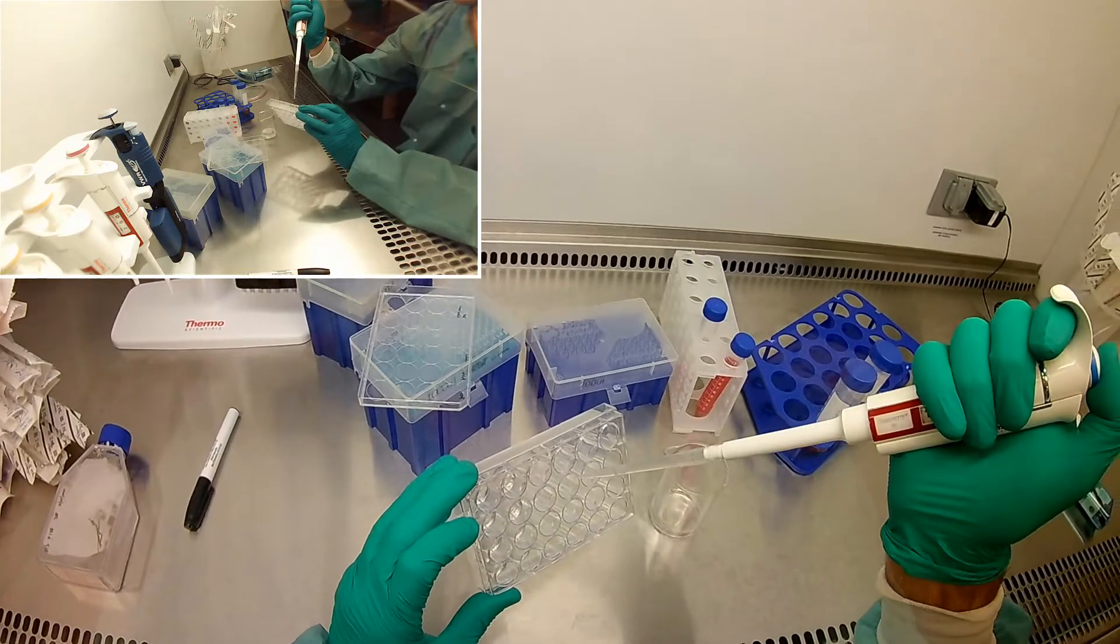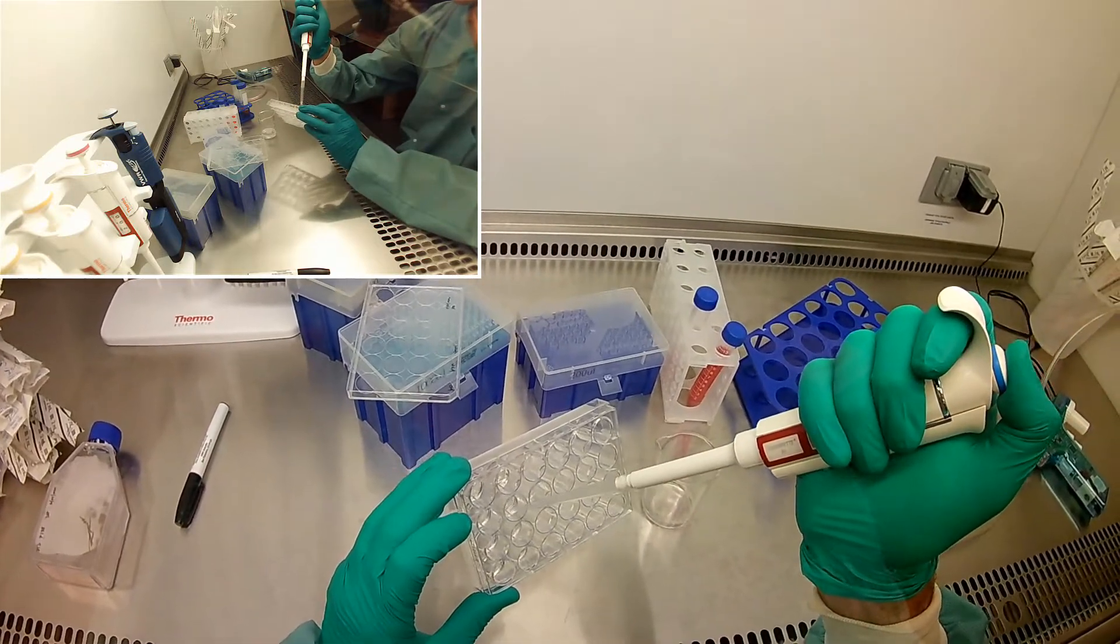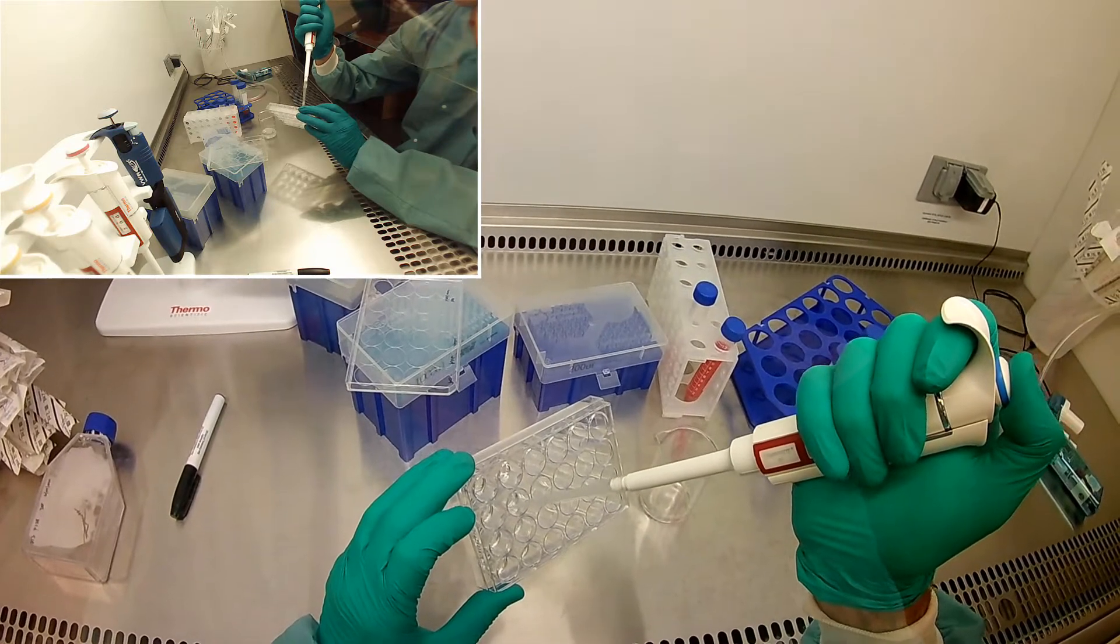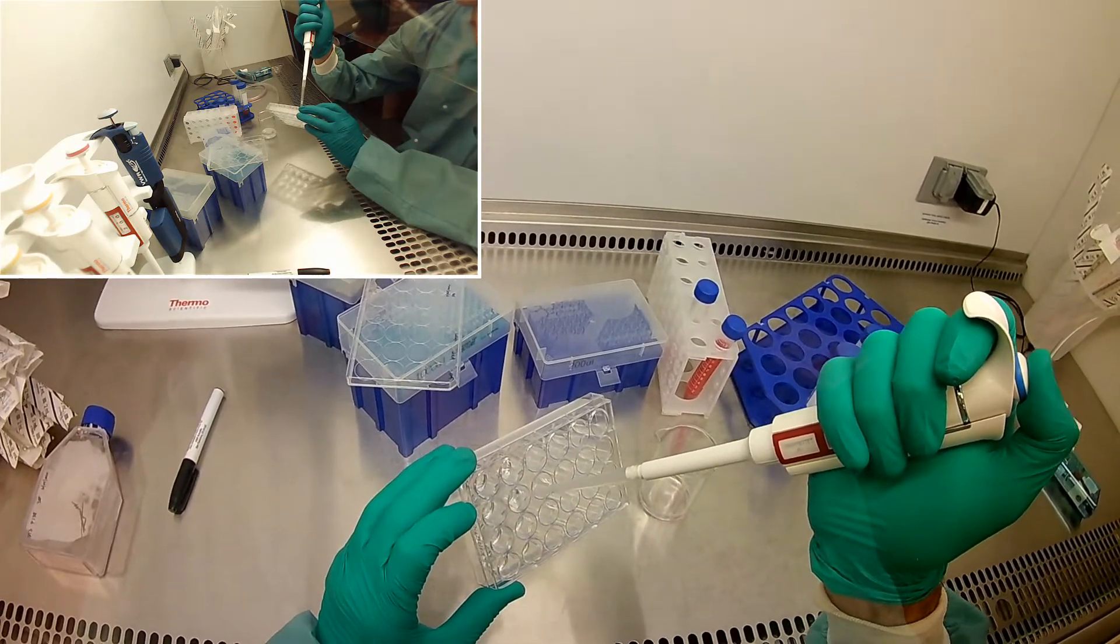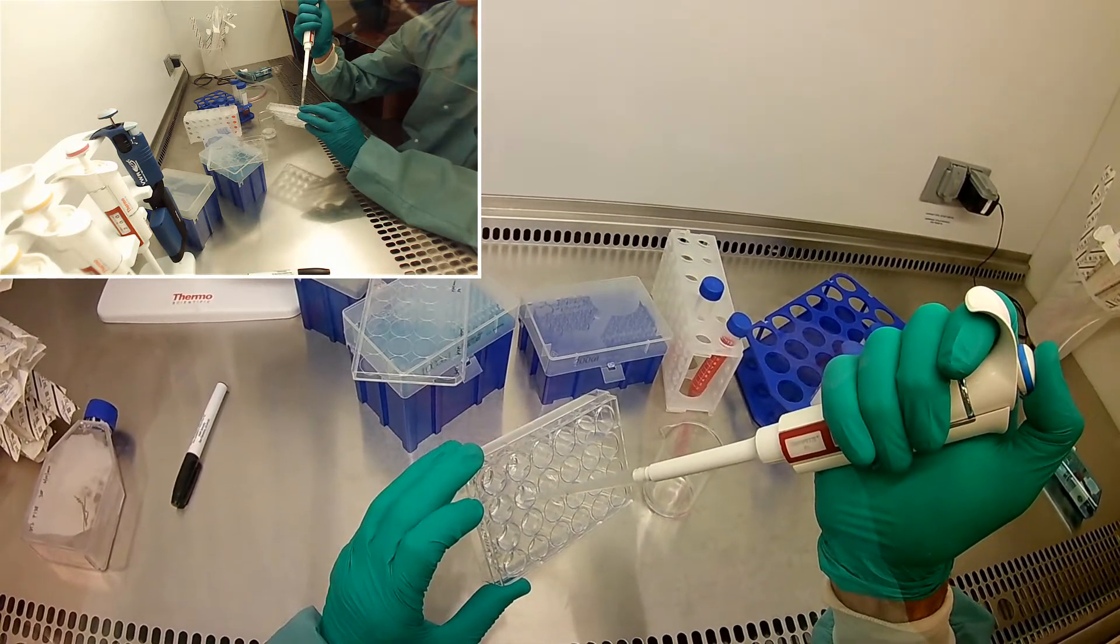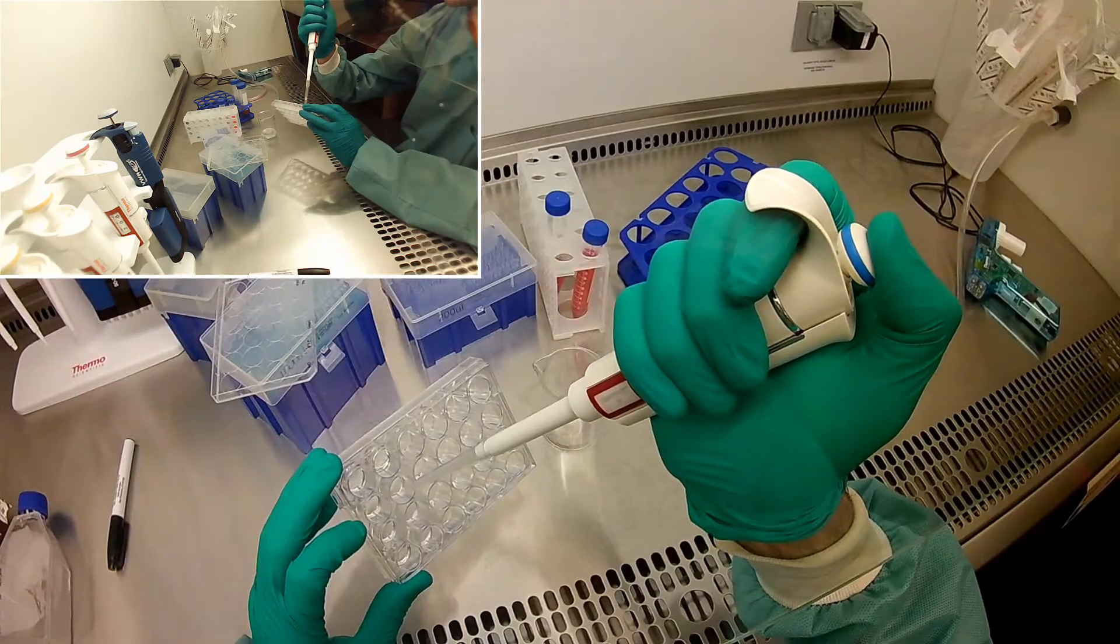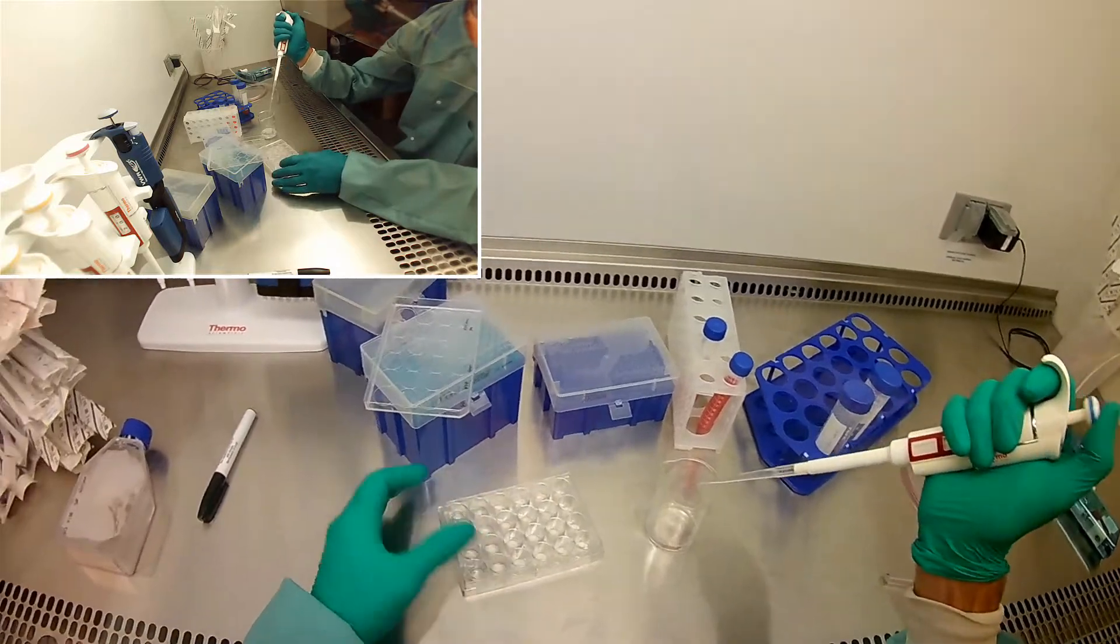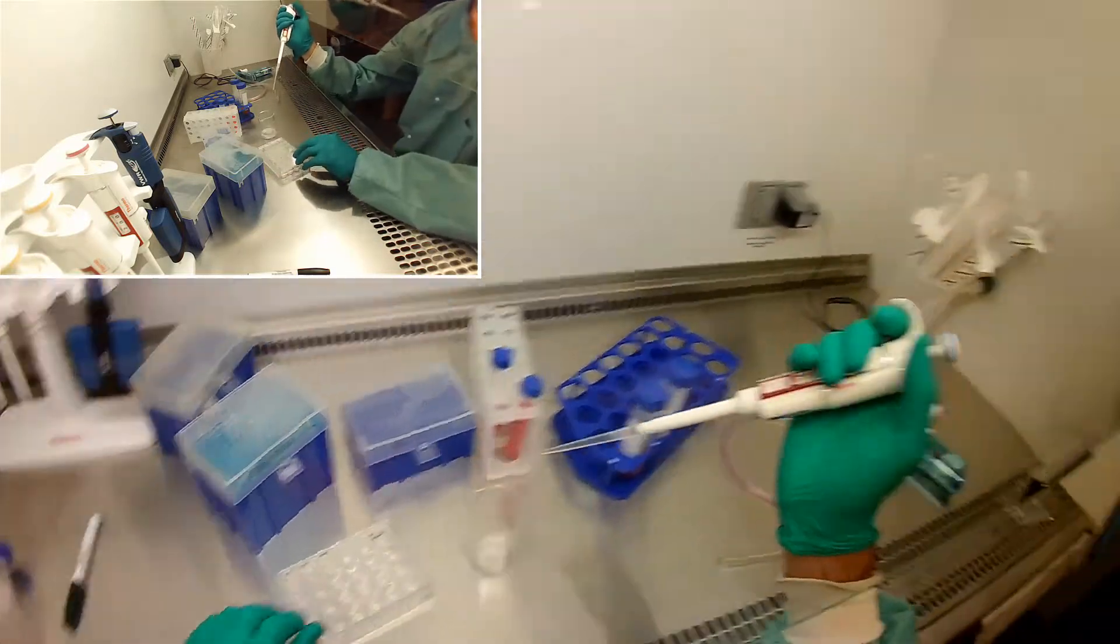So that will be a challenge with our second case here. Because if it is floating, our cells can get under it easier, and that makes things a disaster. Right? Then we didn't see as many cells as we thought on top. Okay, the others look pretty good. So as I push the second one down, the liquid comes out from under it so I can suck it up. Okay, I've done probably as much damage as I want to do.